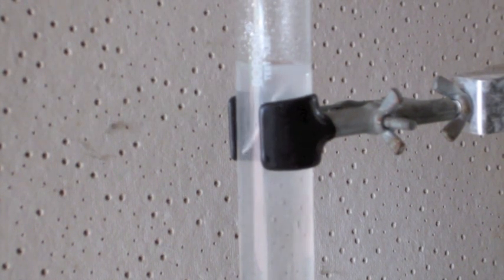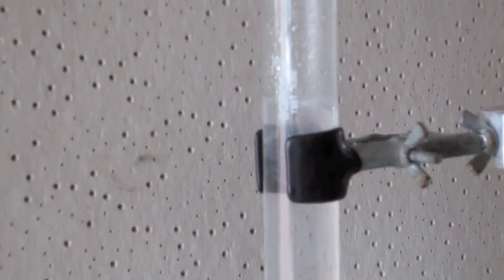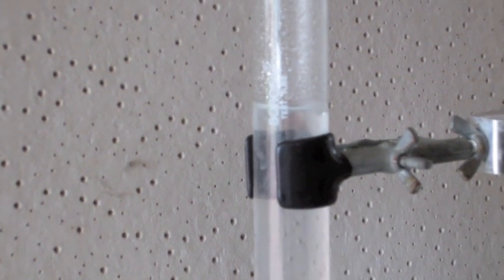Here is the Strontium metal, and now I'm going to put it into water. You can immediately see that, unlike the Calcium, bubbles are being generated. It's bubbling around, going back and forth. The reason it's bubbling so crazily, unlike the Calcium, is because it is in the same column as Calcium but one below it, so its electronegativity is lower and therefore it's more reactive.